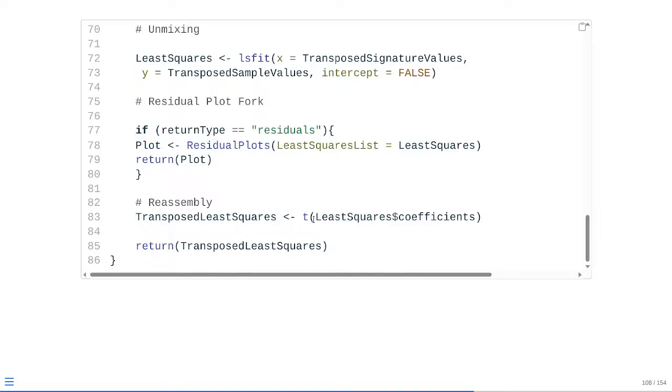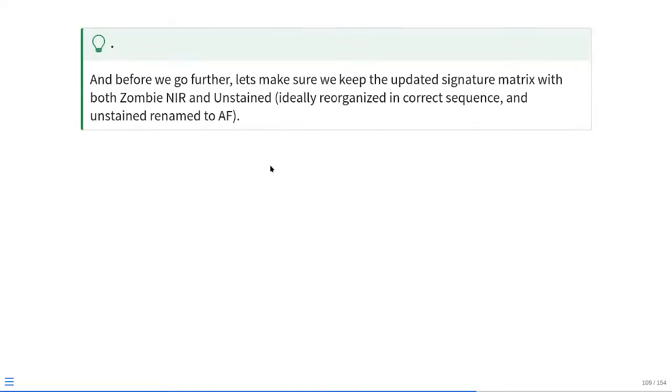We're just going to go ahead and transpose the coefficients, bringing them back into the expected format. And at that point, before we move too far, the last argument we used was using the bead signatures data. We do remember we have both Zombie NIR and unstained signatures that we're trying to add in to be able to unmix correctly, so we need to include these in the signature data. But remember, the individual number of rows and the particular order of those rows is how our actual final FCS file is going to be visualized.